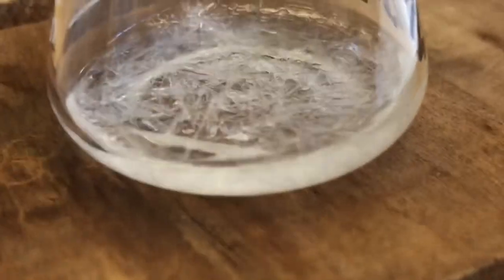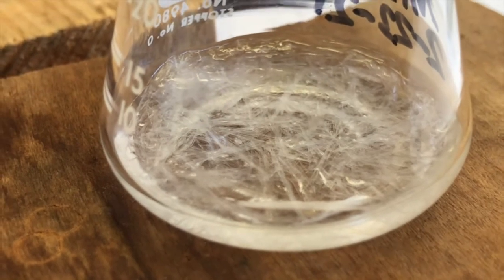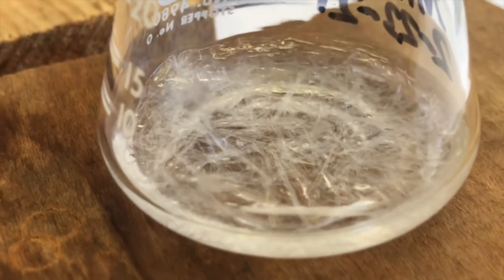If I agitate it or cool it in an ice water bath or something to have more crystals form, they will not be as pure because it'll crystallize quickly. The slower the crystallization, remember, the better the purity. So when I look at this, I think I'm going to just let it be. When I move it around, it'll probably start crystallizing a little more too. Yeah, this looks pretty good to me. So I'm just going to filter it. I'm not going to cool it in an ice water bath. I could, it'll increase the yield, but it'll lower the purity. I'm just going to go with it as is. So now I have to set up my filtration.